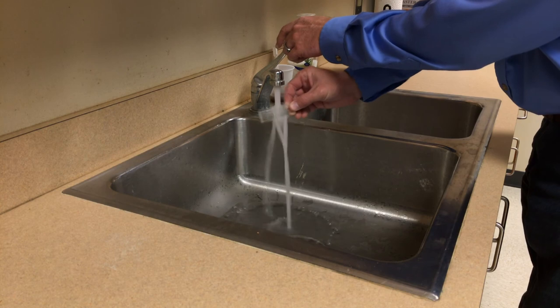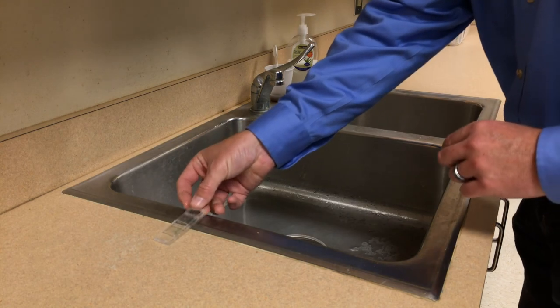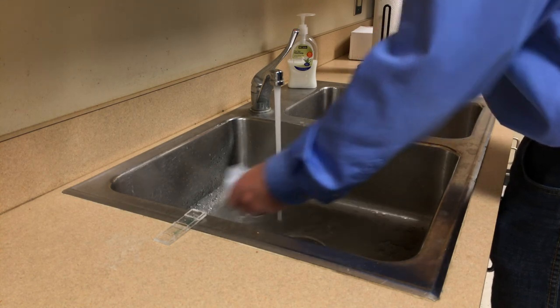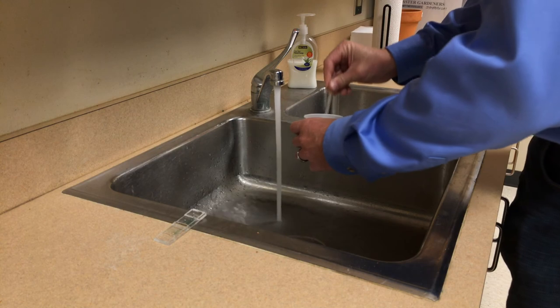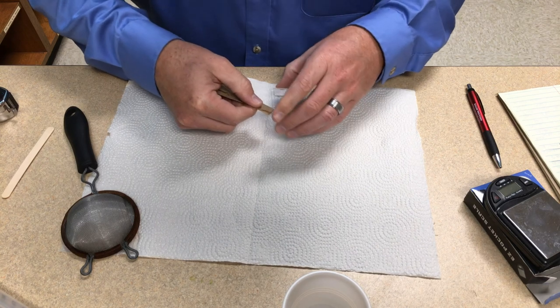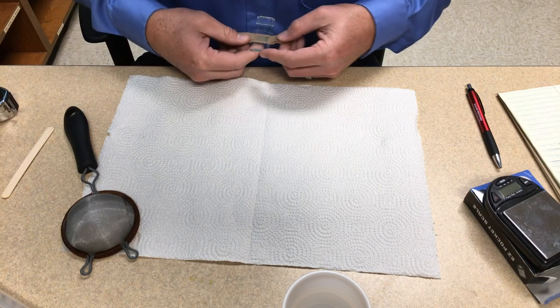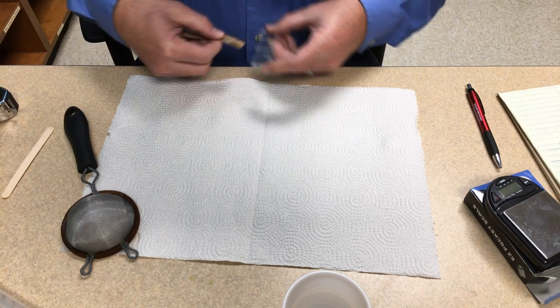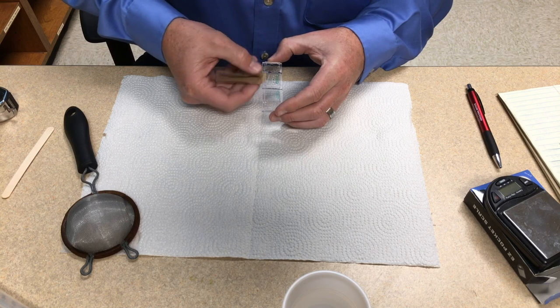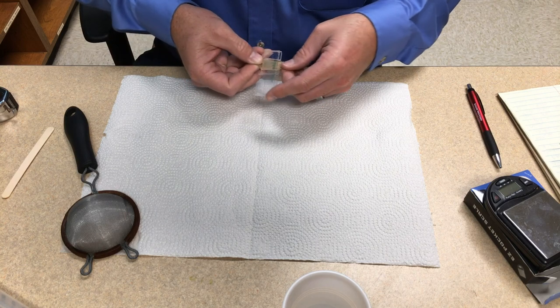No job is finished until the cleanup is done. It's important to thoroughly rinse out your slide and your pipettes and dispose of any used cups. This is a laboratory where all types of samples are frequently handled. It's really important to thoroughly dry your McMaster slide, including inside the chamber, especially if you're about to immediately reuse it. Because if you don't get it thoroughly dry inside, you'll have a lot of air bubbles in that next sample. I use a piece of folded up paper towel, or if you have an air compressor or a can of compressed air, blowing it out works very nicely too.